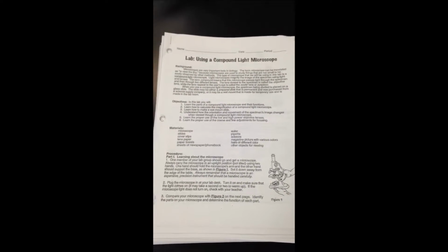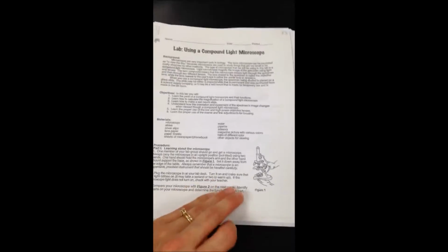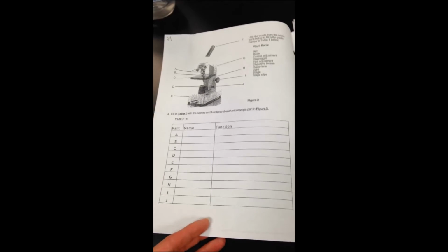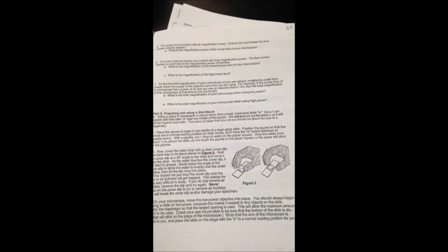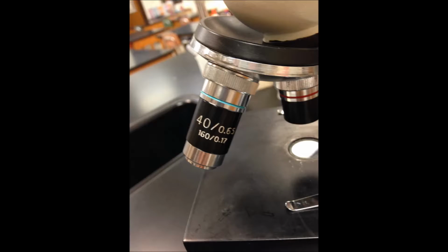Here's what the lab looks like. You're going to be completing this over 2 days, so you should get through this page. Make sure you read the introduction. You're going to start by completing the parts and functions of a microscope. Then you're going to move on to this page where it has you looking at the magnification.